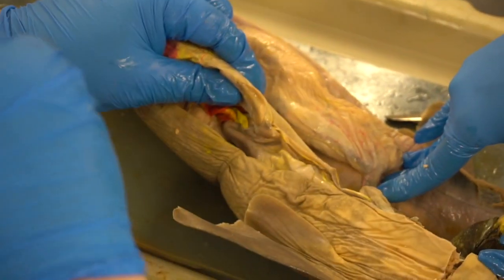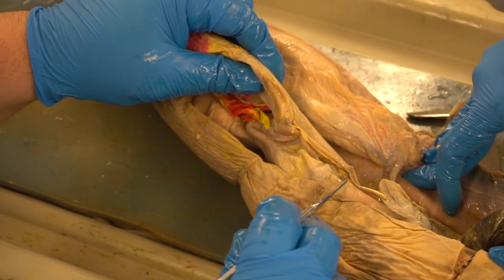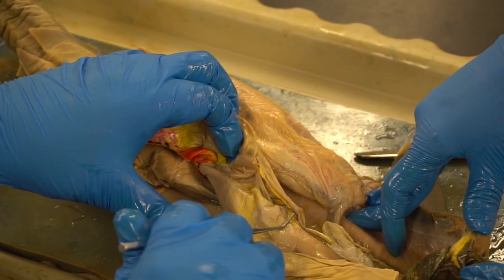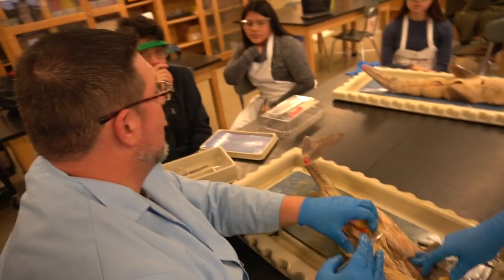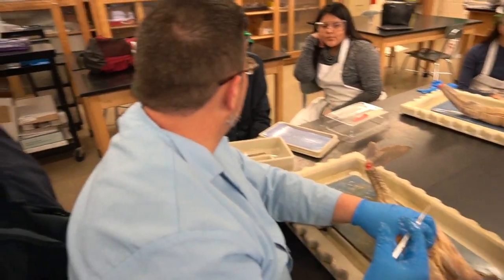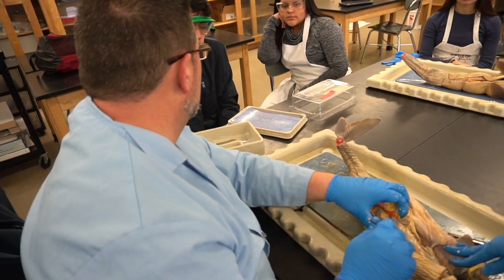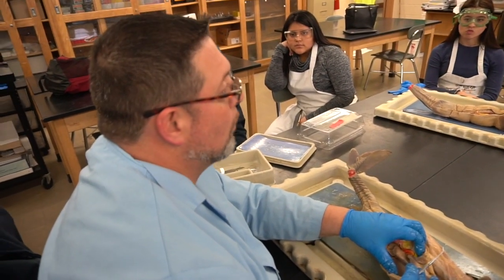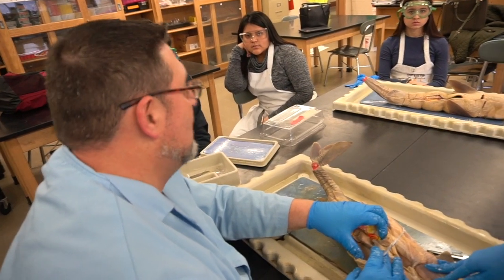This is the area, similarly in us, where all of the digestive enzymes enter, so they can mix with the contents of the stomach as it gets mechanically digested. All right. Remember, the primary job of the stomach, which I actually didn't say, is mechanical digestion. A little bit of churning action, okay, some chemical bathing with some acids, start to break down the food product that was eaten. And remember, with sharks, they ingest everything whole. Okay, most fish do. So whatever comes down in here needs to get totally broken down to a liquid form as best possible. The only thing that's not going to be broken down to liquid form would be bones. Everything else can be liquefied.